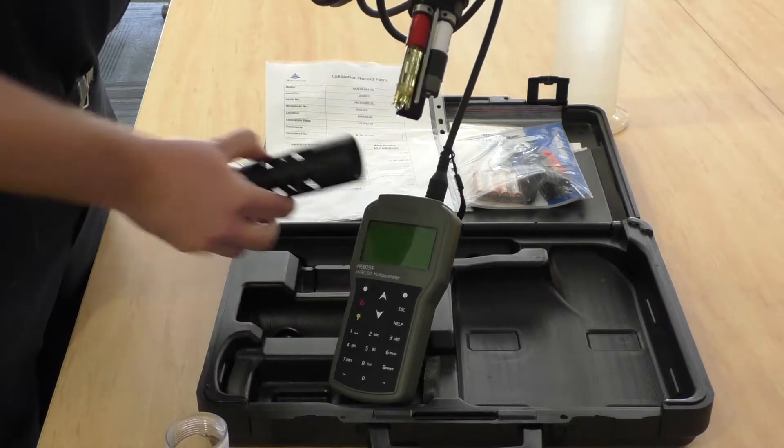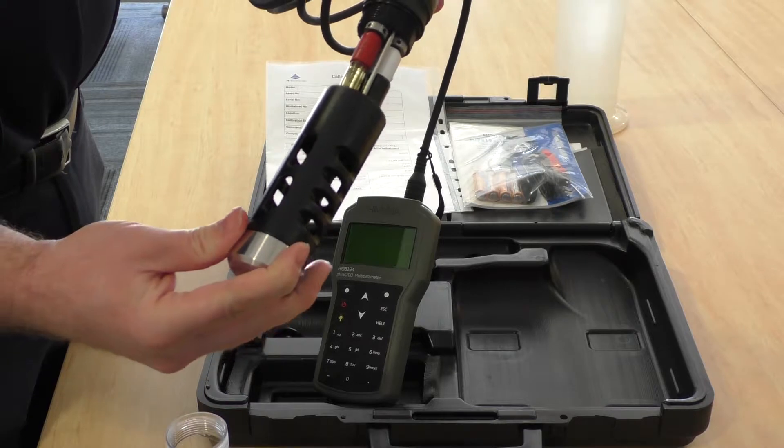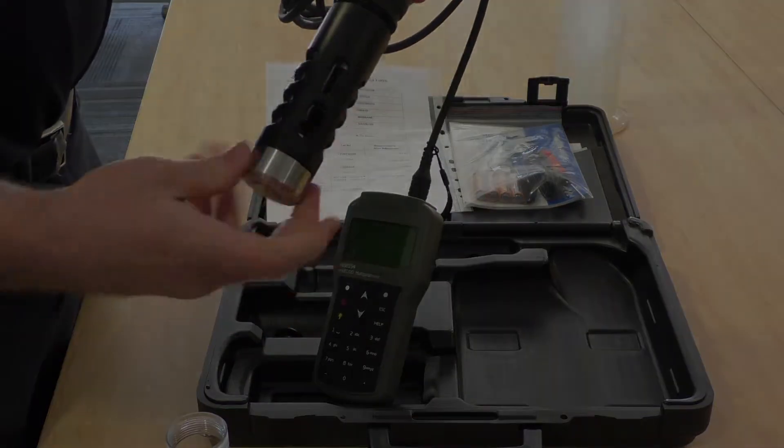Now to protect the sensors when you're using it, you'll need to put on the protective shield, which screws on like that.